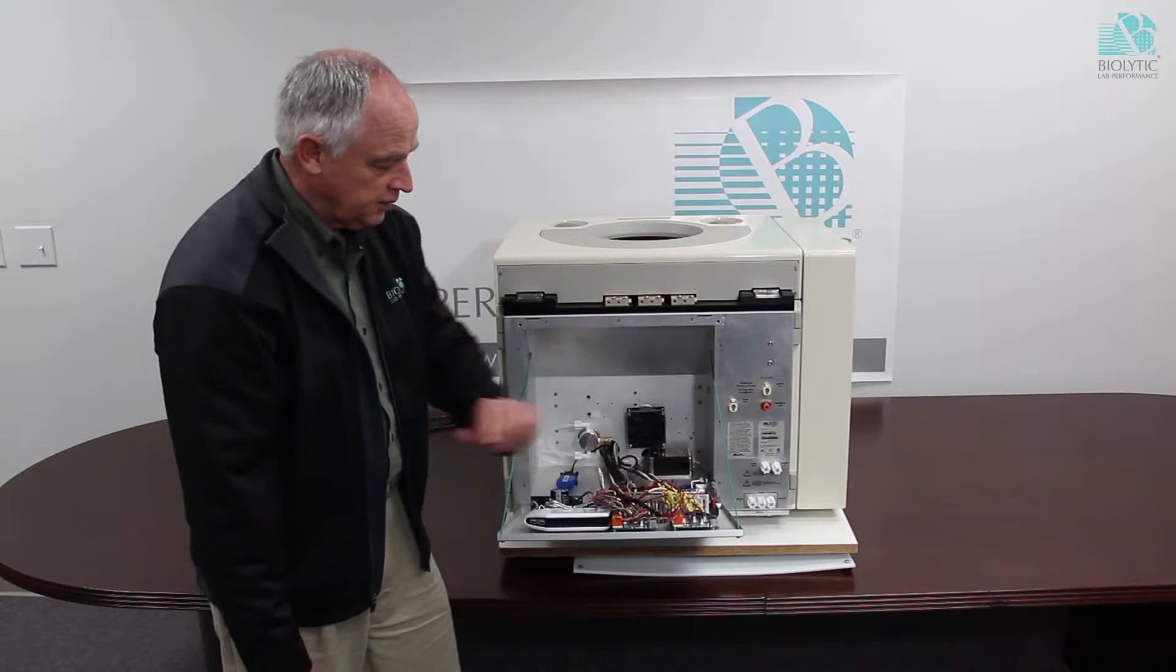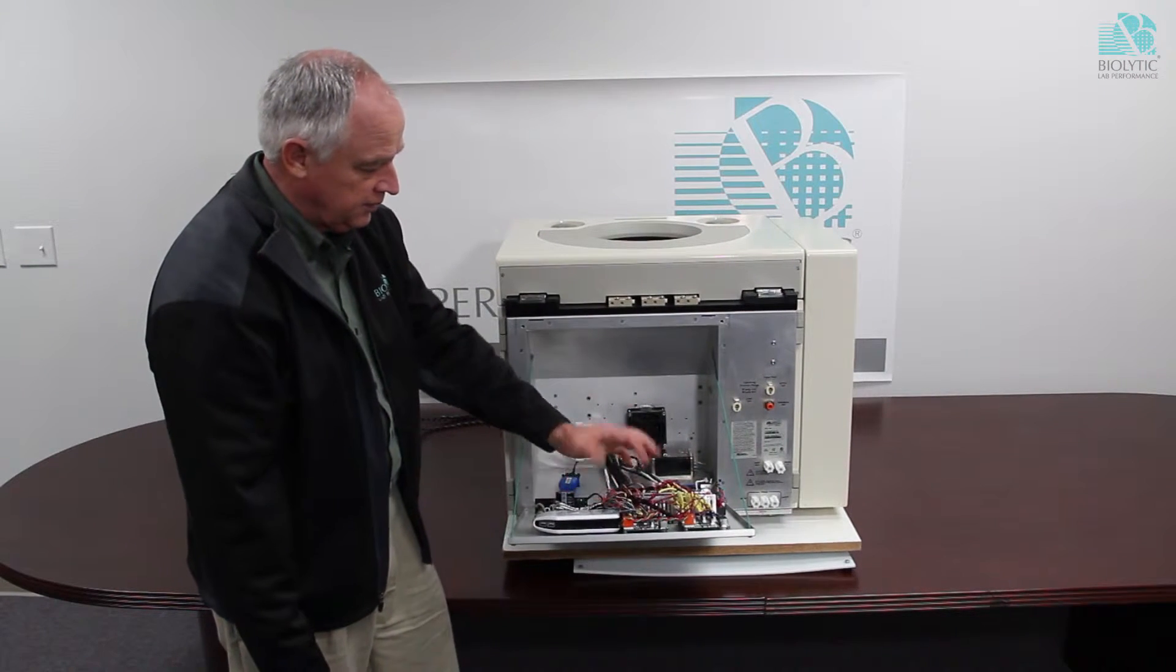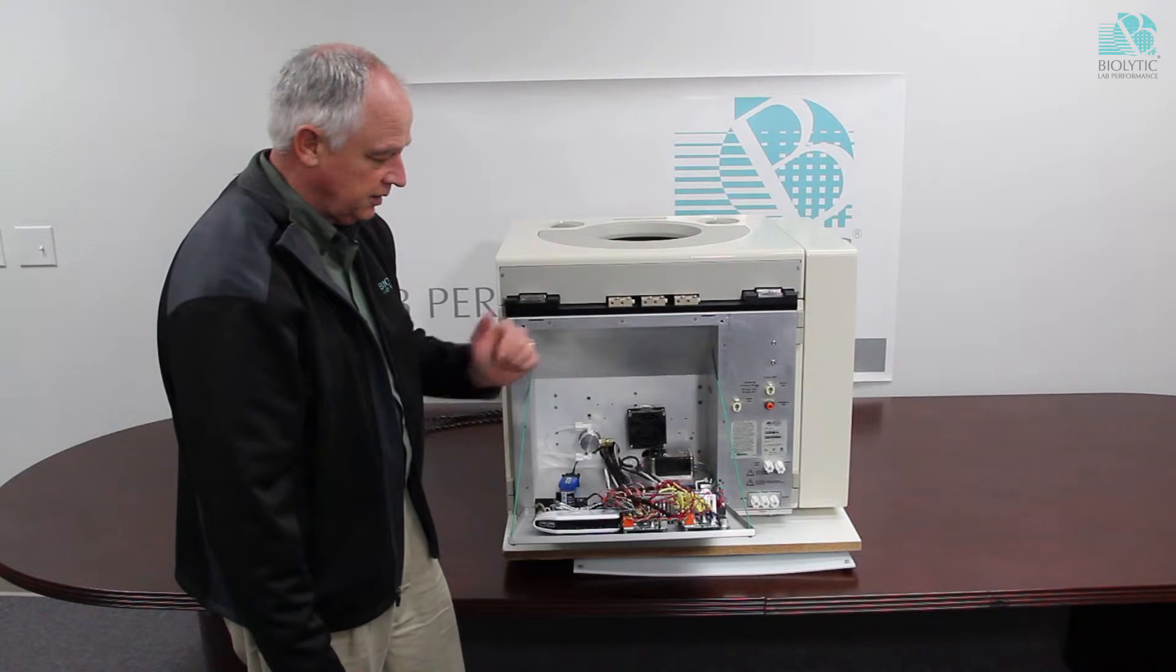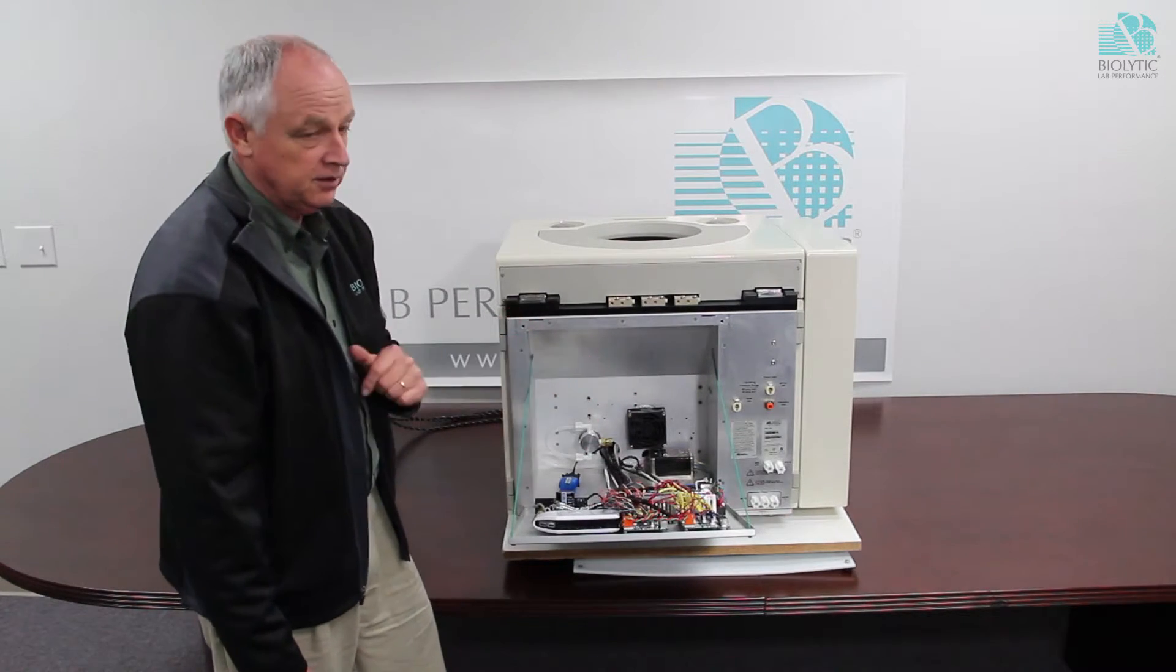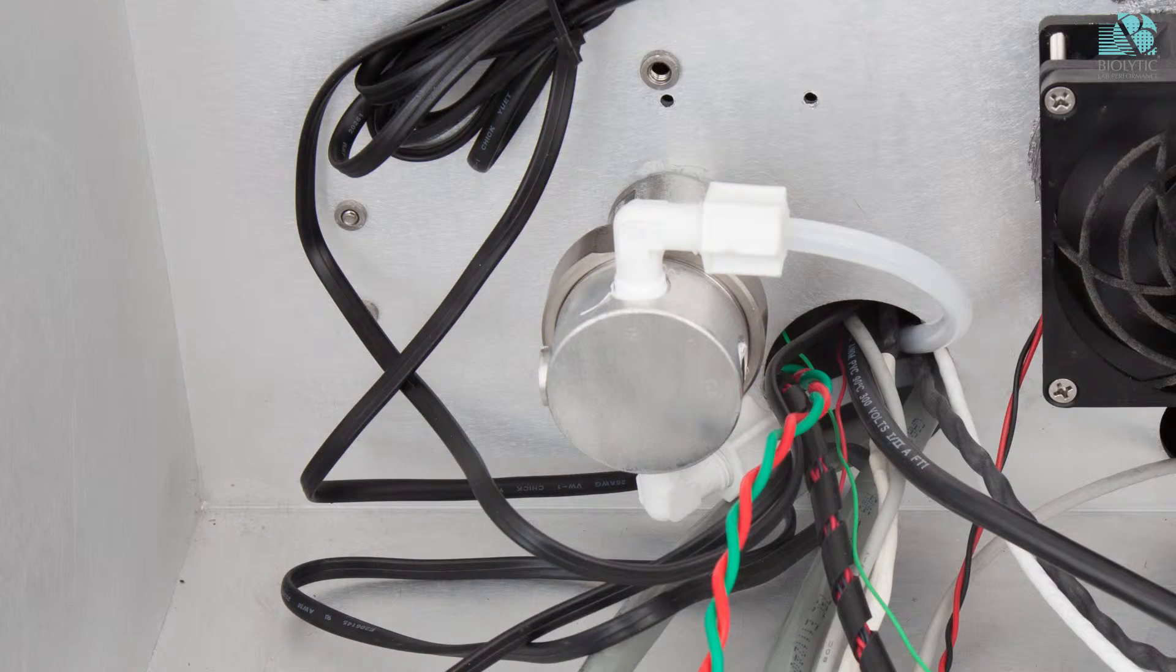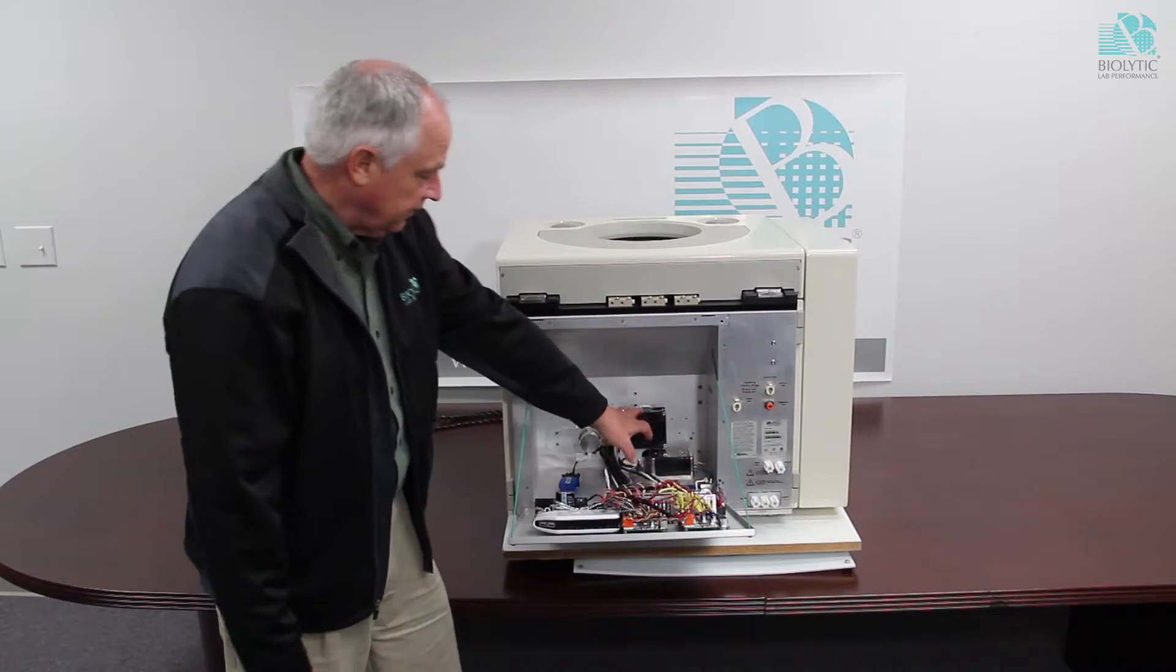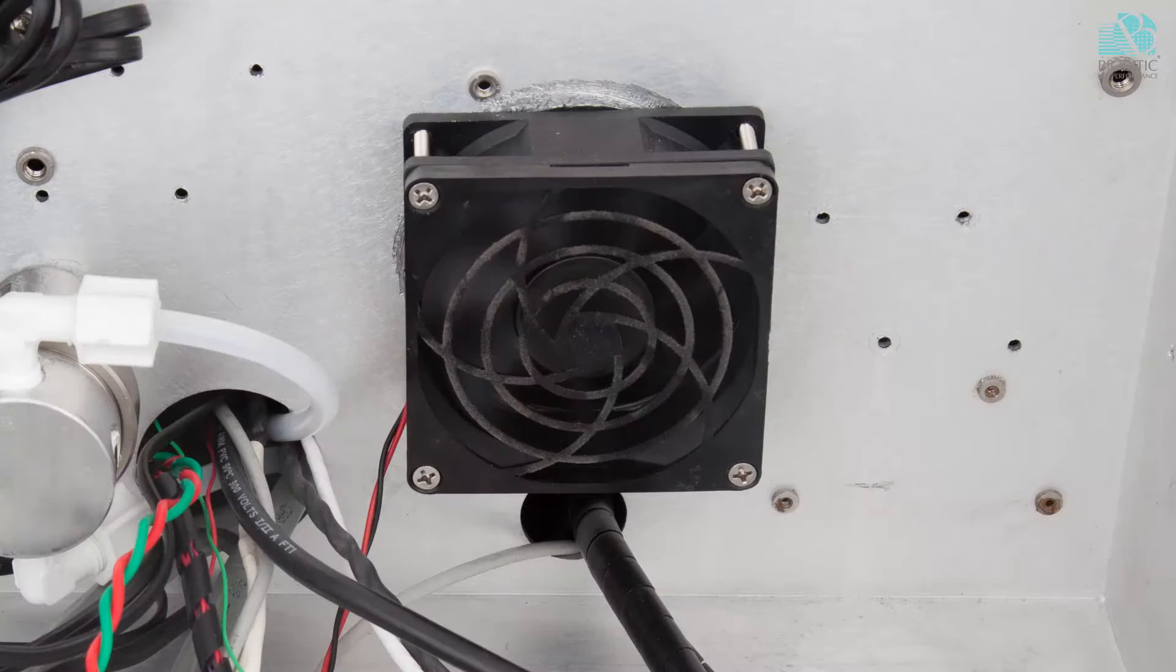Valve control boards, these are intelligent valve control boards. If a valve shorts out, they will shut down the individual port that's shorted and will not destroy themselves. We installed another regulator here and we've added a fan in here to cool the motor.